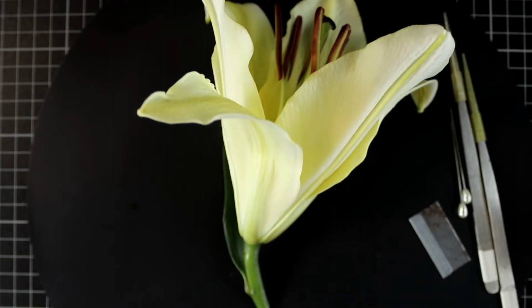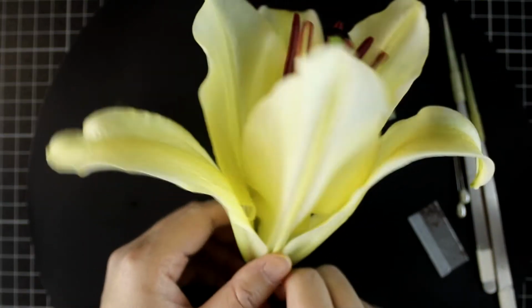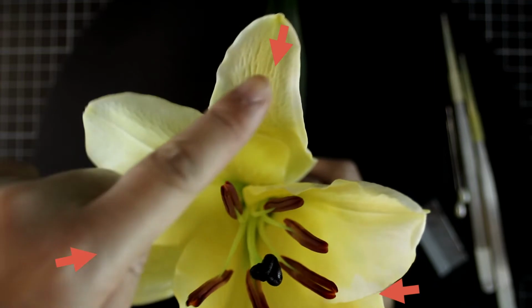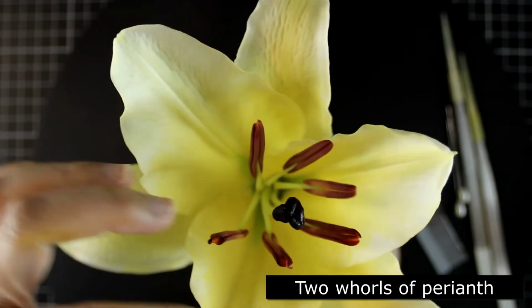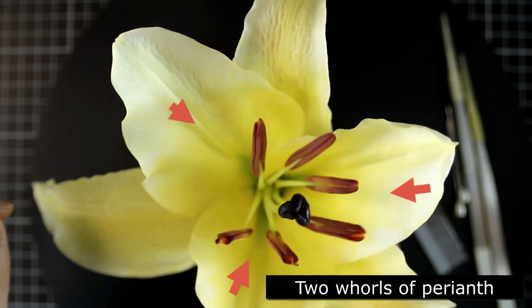So the next information you should obtain is about the nature of different parts. Here is the outermost whorl. 1, 2, 3. There are 3 perianth parts. And there is another whorl of perianth parts. 1, 2, 3.